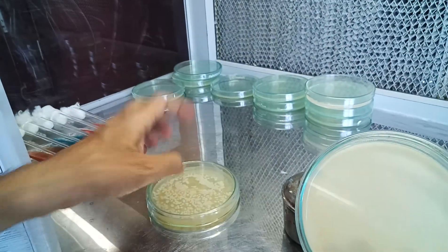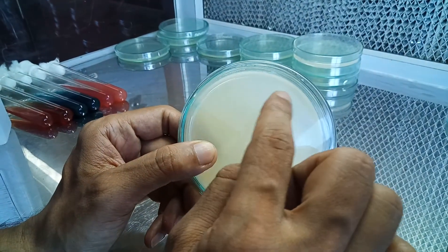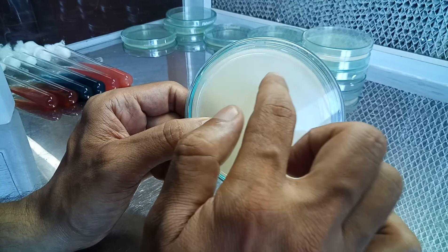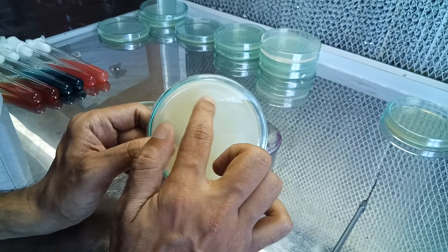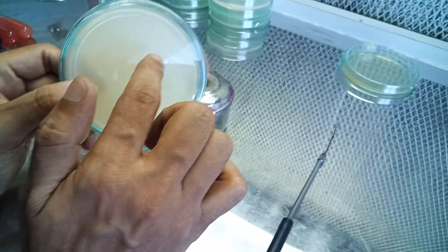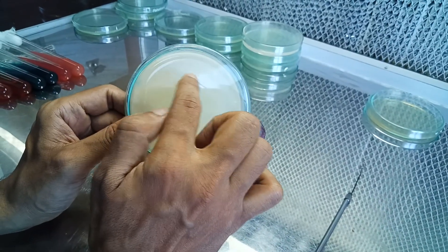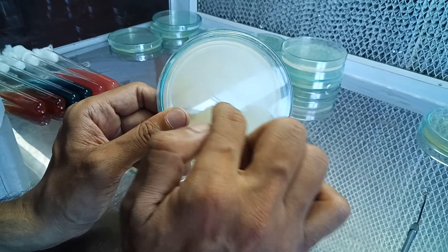If the bacterial colony inoculated into this casein agar is capable of breaking down casein, then once the bacteria grow into the streak, they will produce the caseinase enzyme — a protease — which will break down the casein present all around the plate. As a result, the plate looks opaque initially, but if the bacteria can break down casein, we will see a zone of clearance around the bacterial colonies.